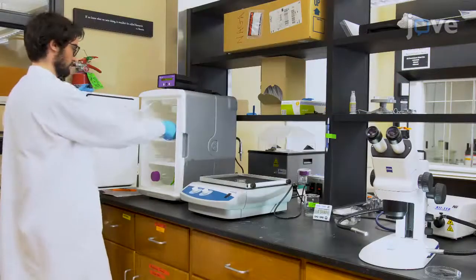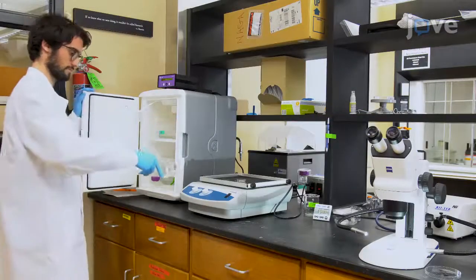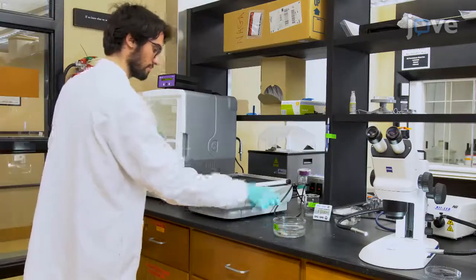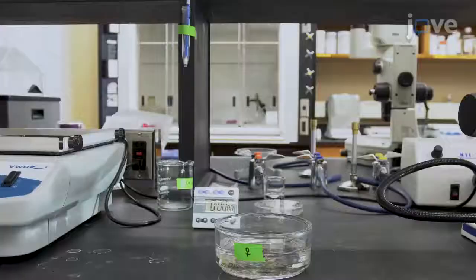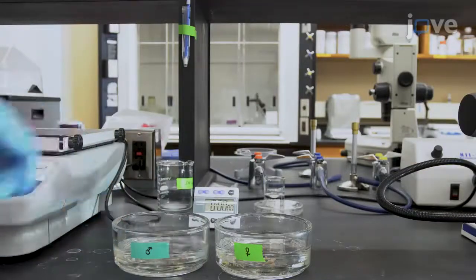On the following day, remove the animals from the incubator and leave them on a benchtop at room temperature with the light on to allow spawning, which will occur within the following one and a half to two hours.